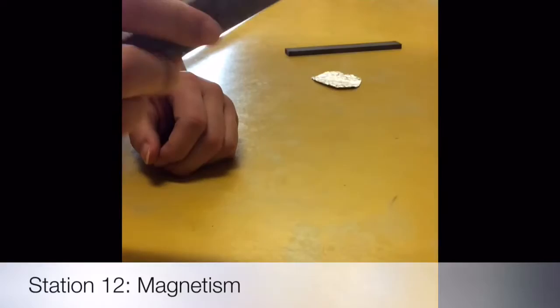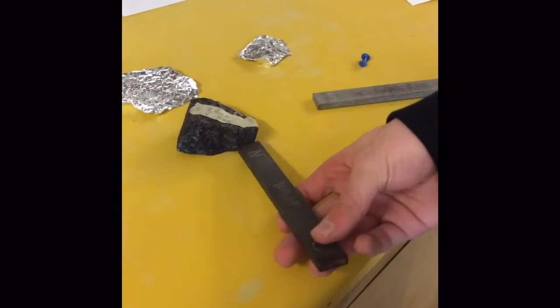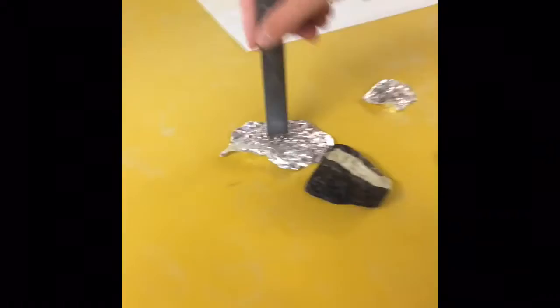So magnetic attraction. That is a little magnetic. This, not magnetic. And then we got a thumbtack, that is magnetic.